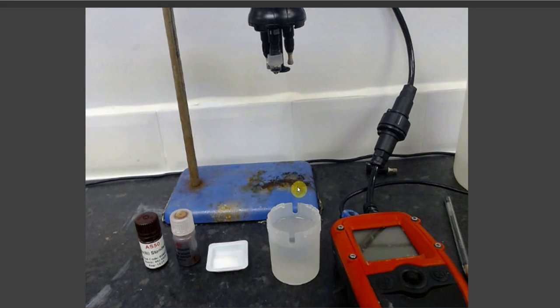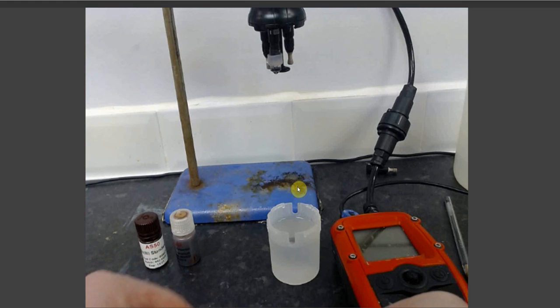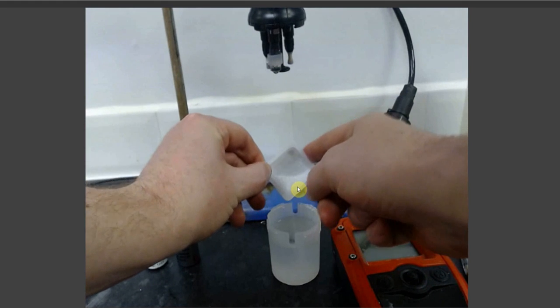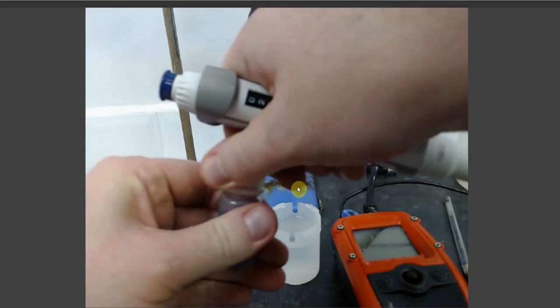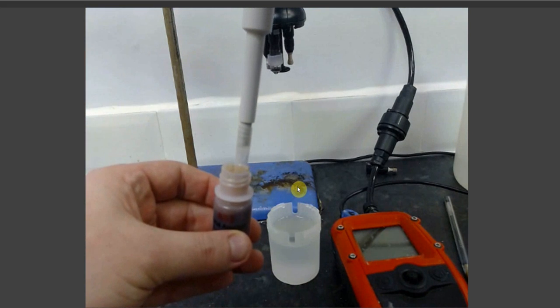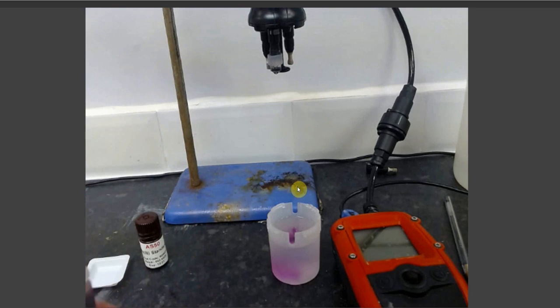The first step in the process is sample preparation. To do this, add your 2.15 grams of AS1 buffer to your sample and then pipette 280 microliters of your AS2 preparation solution into your sample water.